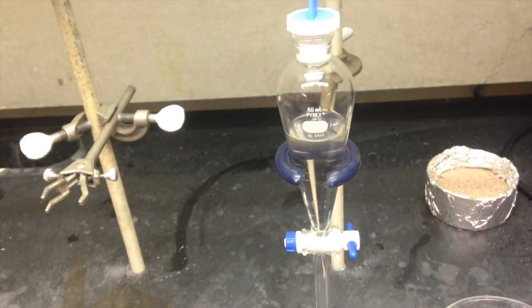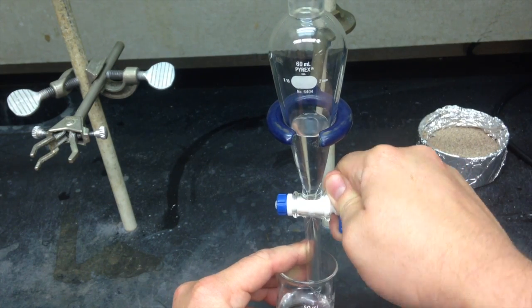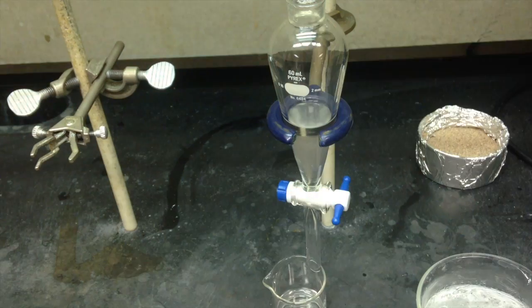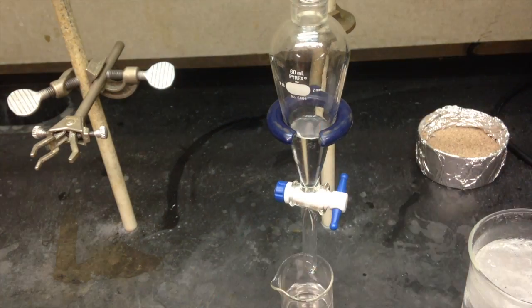Still doesn't work, a little bit more water, a little bit more ether, shake again, and so on and so forth. When you have your nice clear solution, remove the aqueous phase, add more water, shake again. Remove the aqueous phase, add more water, shake again. This to get out any remaining byproducts that could be in your extraction.